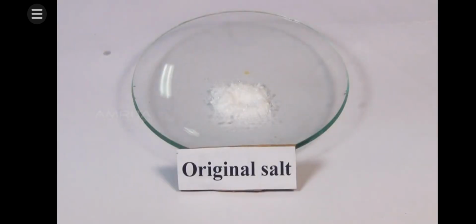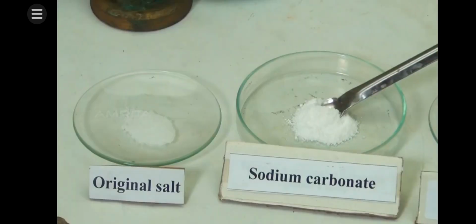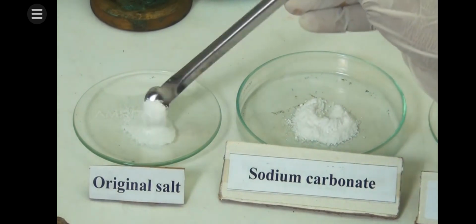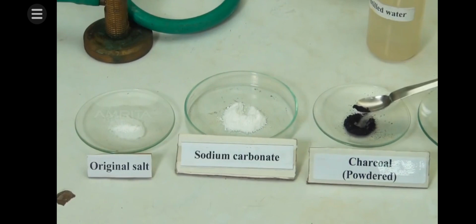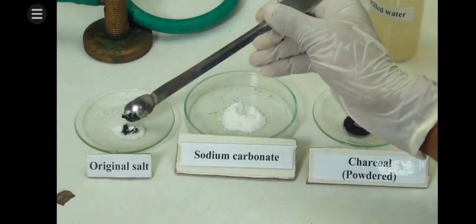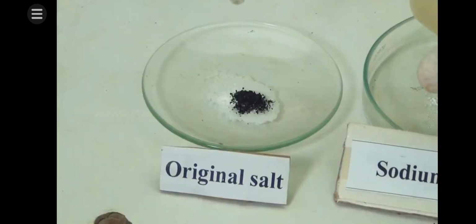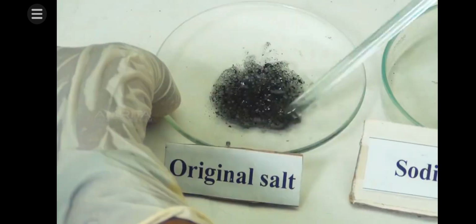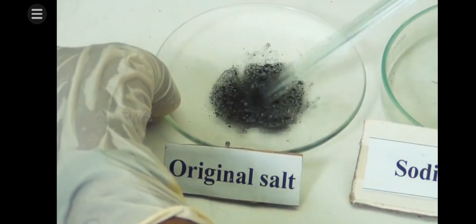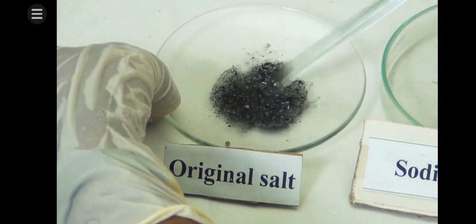Procedure: take a small amount of the salt in the watch glass. To this, add a small amount of solid sodium carbonate using a spatula. Then, add a little powdered charcoal using another spatula. Now, add a few drops of distilled water to the mixture. Mix the contents of the watch glass with the glass rod so as to get a paste.